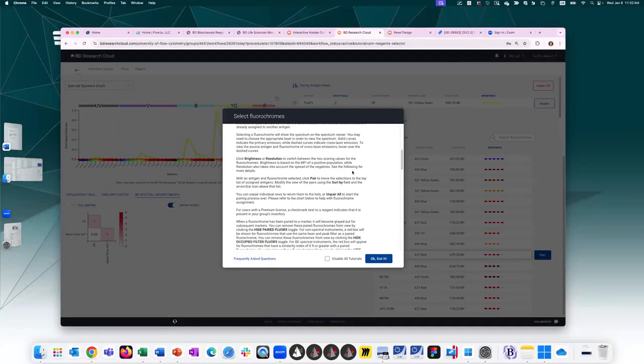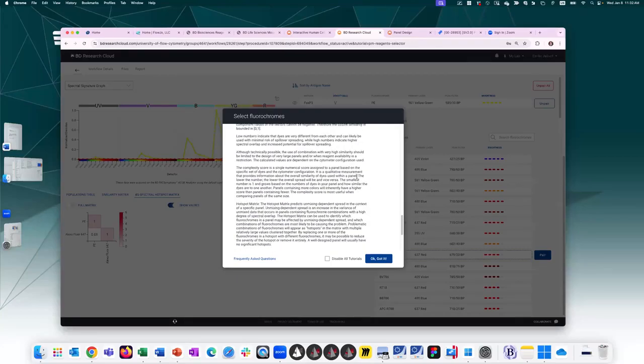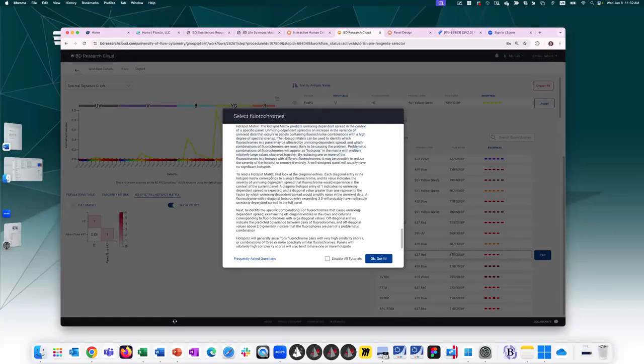But if you keep scrolling, there's a lot of information. It tells you how we've calculated the brightness and the resolution for these fluorochromes. But at the very bottom here, it talks about the hotspot matrix. So it talks about the hotspot matrix, how it works, and then here, how to read a hotspot matrix. First, look at the diagonal entries. Each diagonal entry in the hotspot matrix corresponds to a single fluorochrome, and its value indicates the severity of unmixing dependent spread that fluorochrome will experience in the context of the current panel.